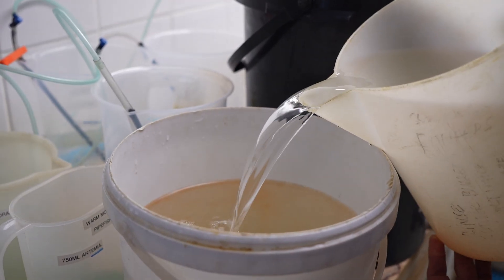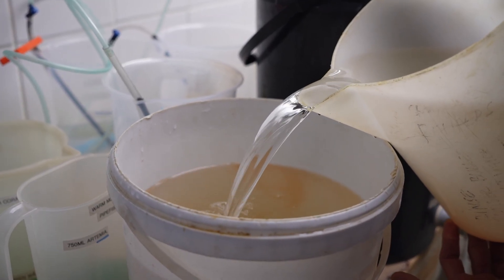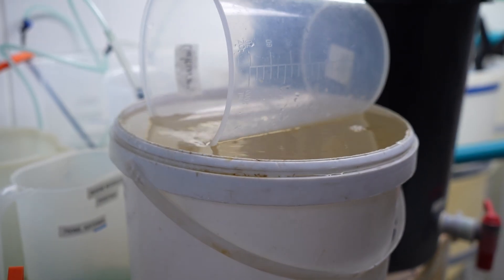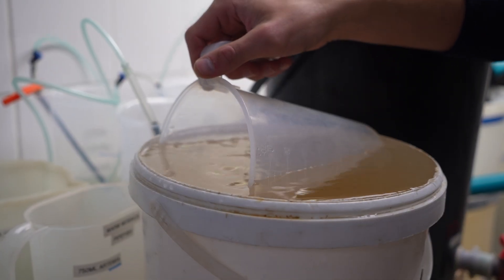But we don't want to waste artemia because within that, there are still living artemia that we can use as food. So we're trying to preserve as much as possible. And so we're going to take from this and pour it over very carefully to try to get as much of the living artemia, which are going to be on top, and the dead artemia and the unhatched eggs, which are going to be on the bottom. So today's hatch isn't super dense. We won't be siphoning again. And now we just distribute it amongst everybody that needs.